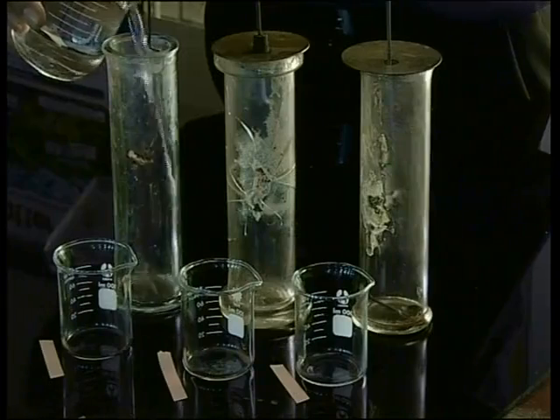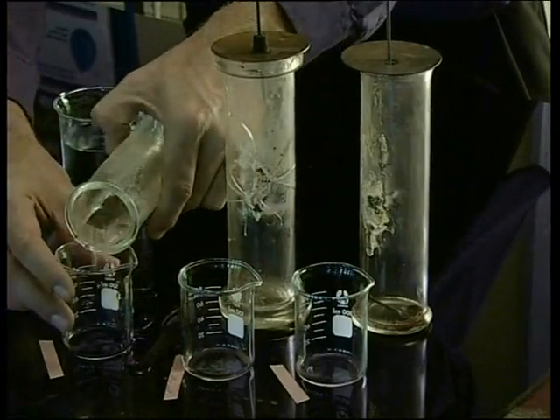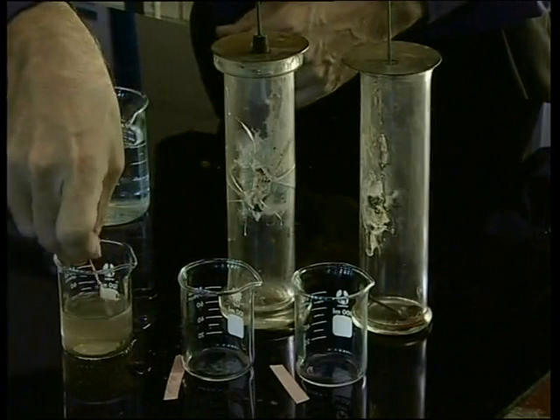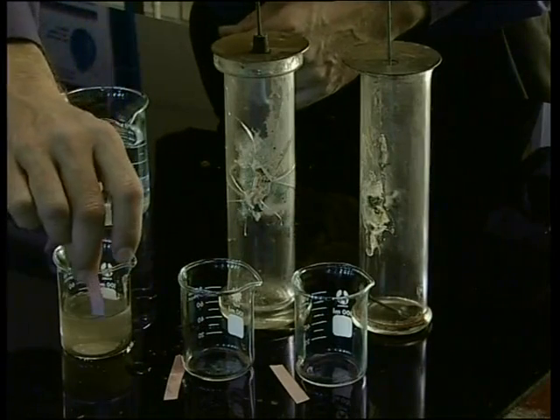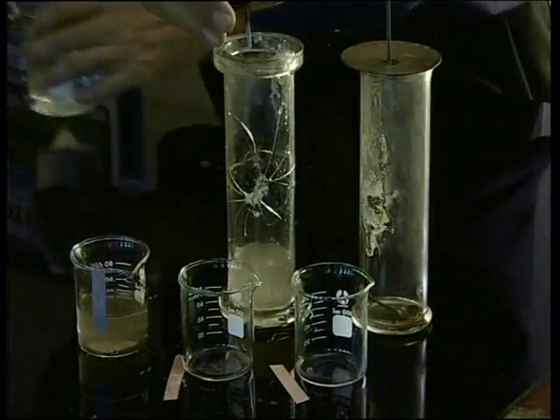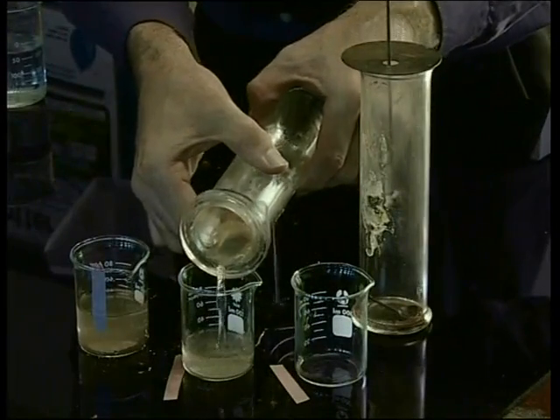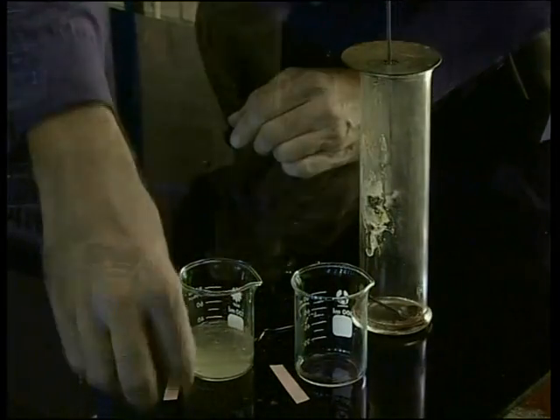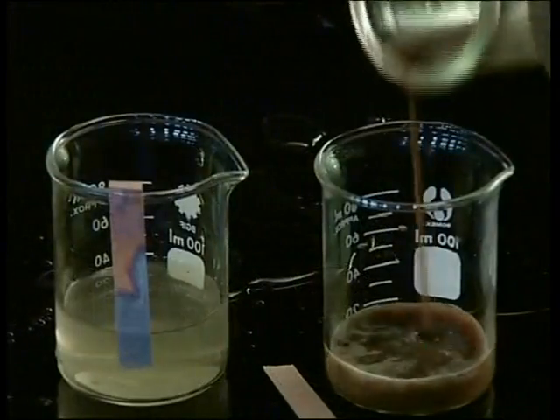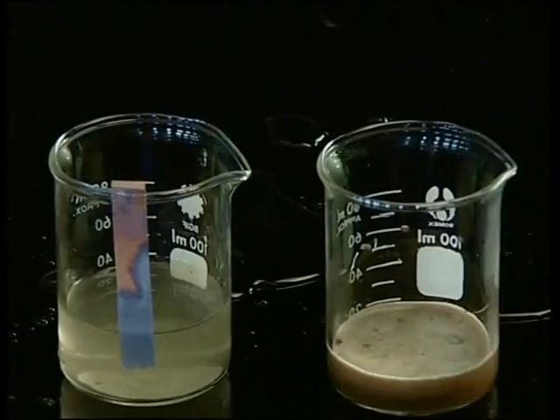First, we add water to the jar containing the lithium oxide and shake it. The lithium oxide is soluble in water. The red litmus paper turns blue, which means that the solution is basic. When we repeat the experiment with the sodium oxide and the potassium oxide, we find that the results are the same. Both sodium and potassium oxide dissolve completely in water, and in both instances the red litmus paper turns blue, indicating that both solutions are basic.